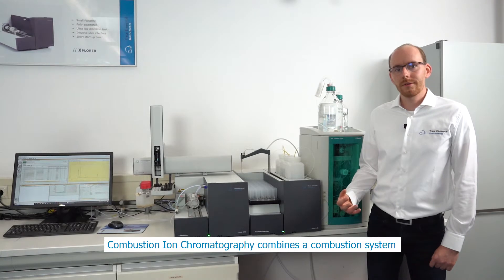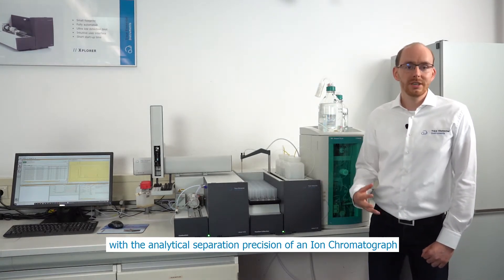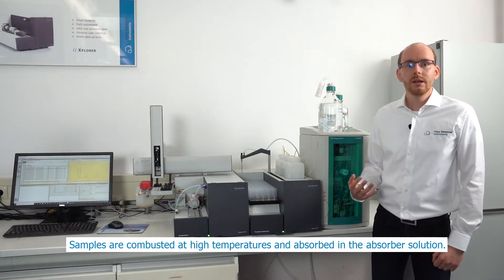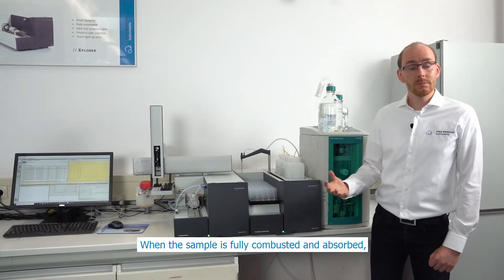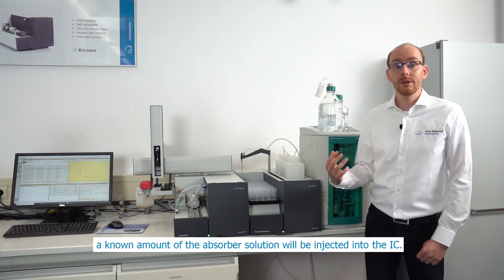Combustion ion chromatography combines a combustion system with the analytical separation precision of an ion chromatograph in a fully automated configuration. Samples are combusted at a high temperature and absorbed in the absorber solution. When the sample is fully combusted and absorbed, a known amount of absorber solution will be injected into the IC.